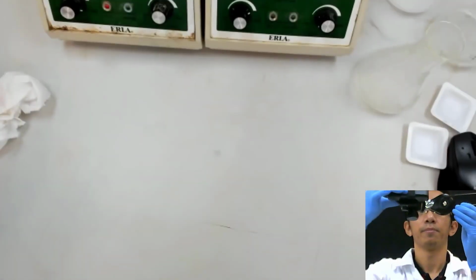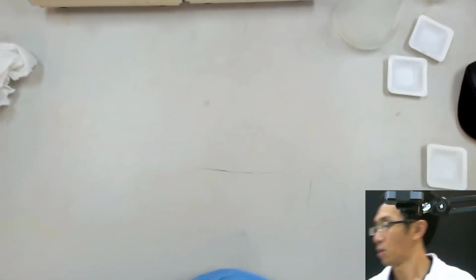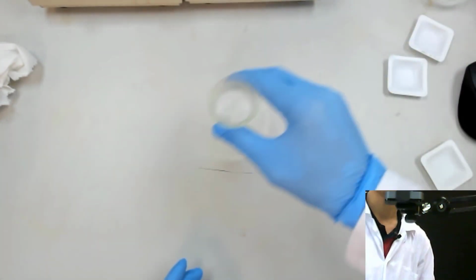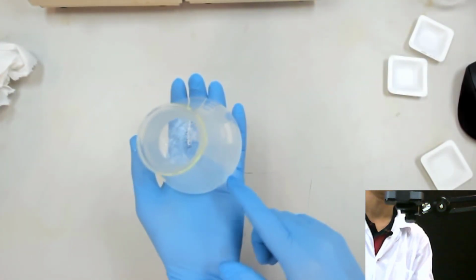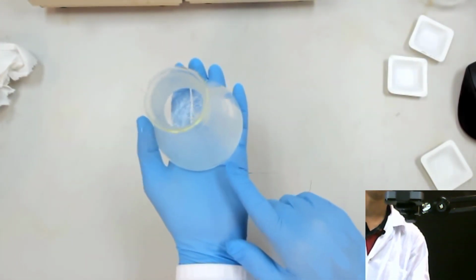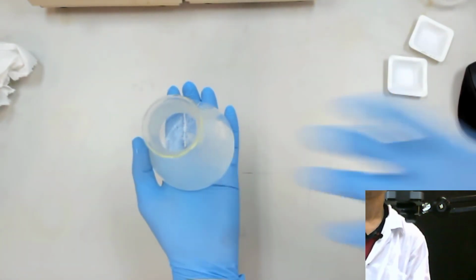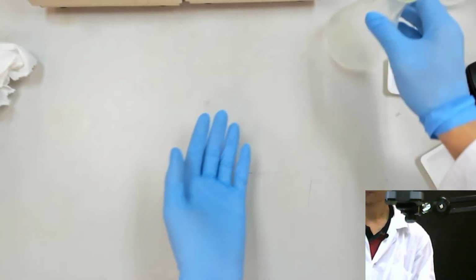So now what we'll do is that we will filter whatever that we have now. For example, this is our needle stuff there. We want to filter this. The reason why we want to filter this, we want to take out the needle, okay, and then to weigh it. To weigh the weight of the needle itself.